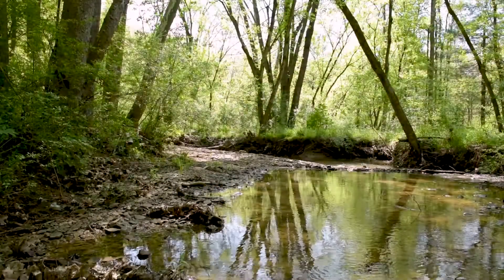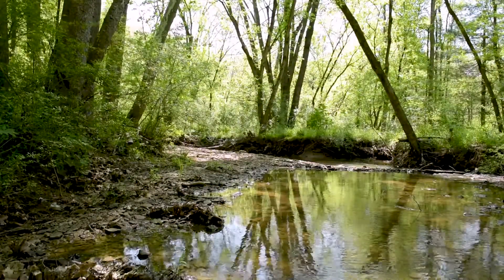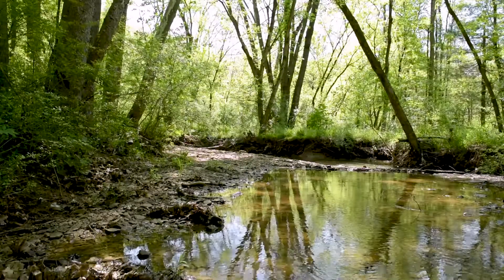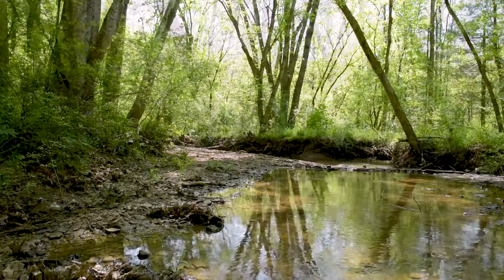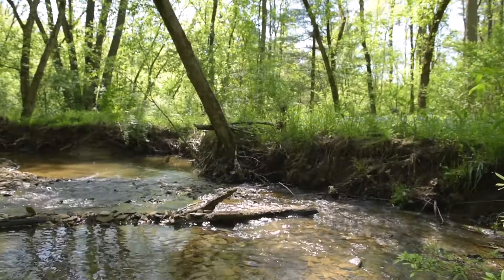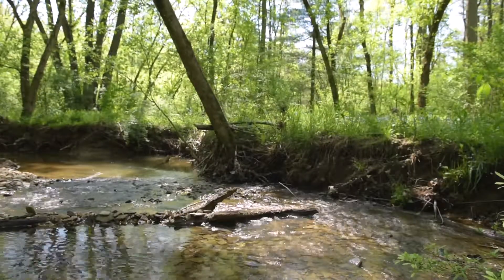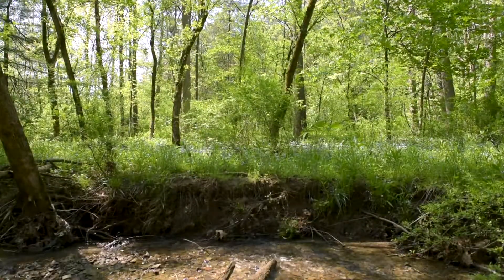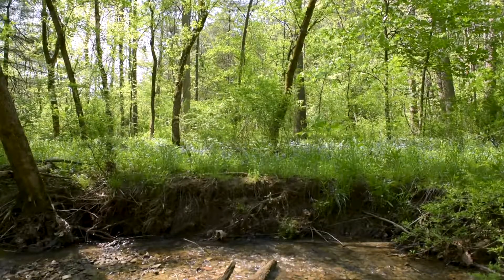So let's get started. First, we need to make an assessment of the stream, looking for a long stretch that has water moving quickly over the rocks. This is called a riffle. We will only be sampling in the riffle and not standing water or pools. We sample from a single riffle, and if you have the choice of riffles, sample the one with more sunlight.